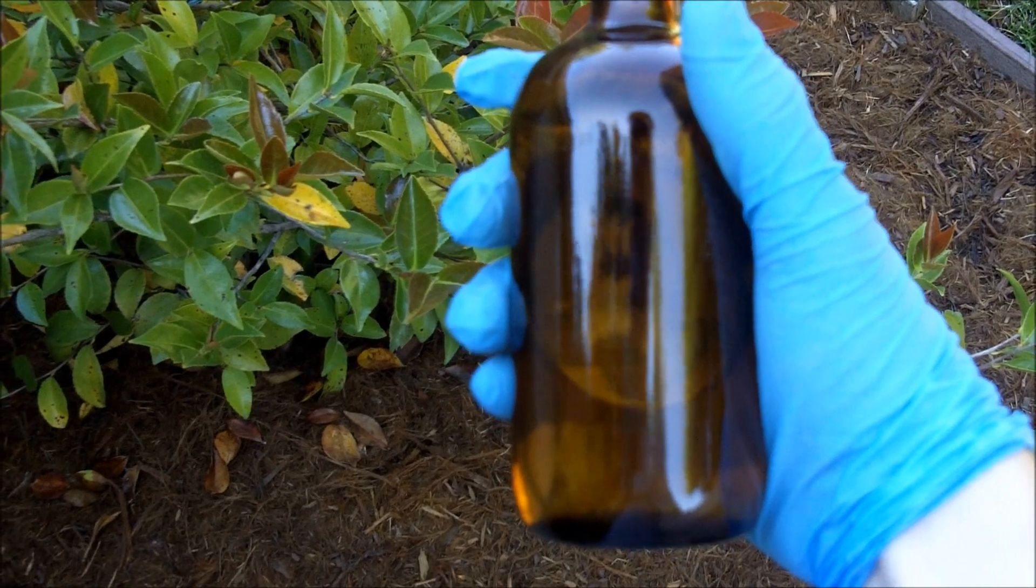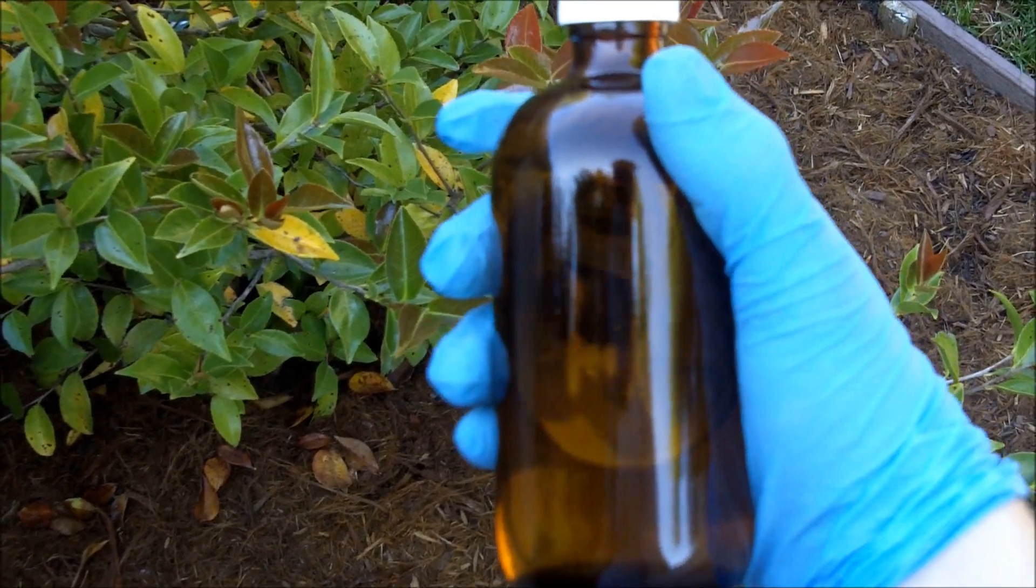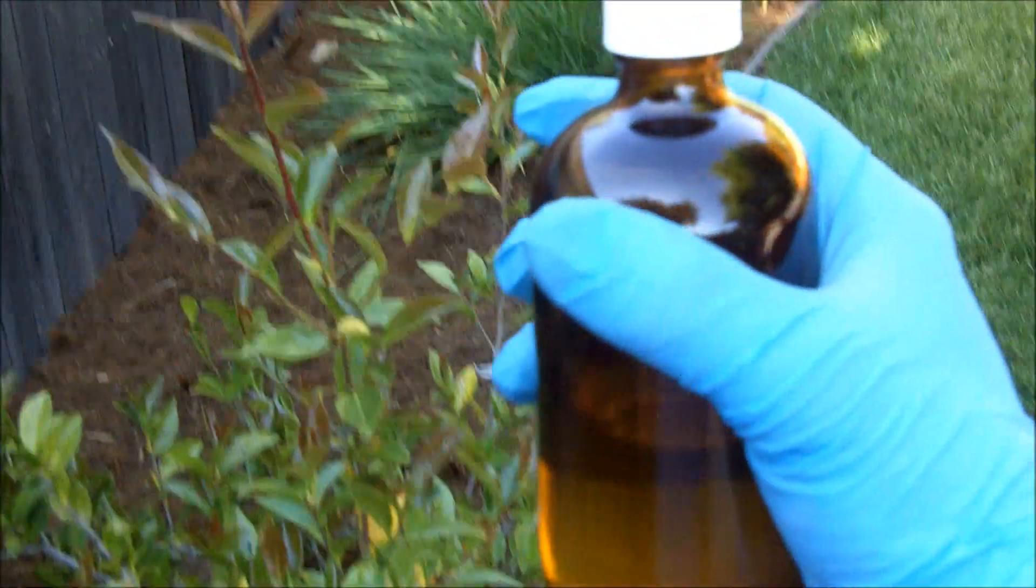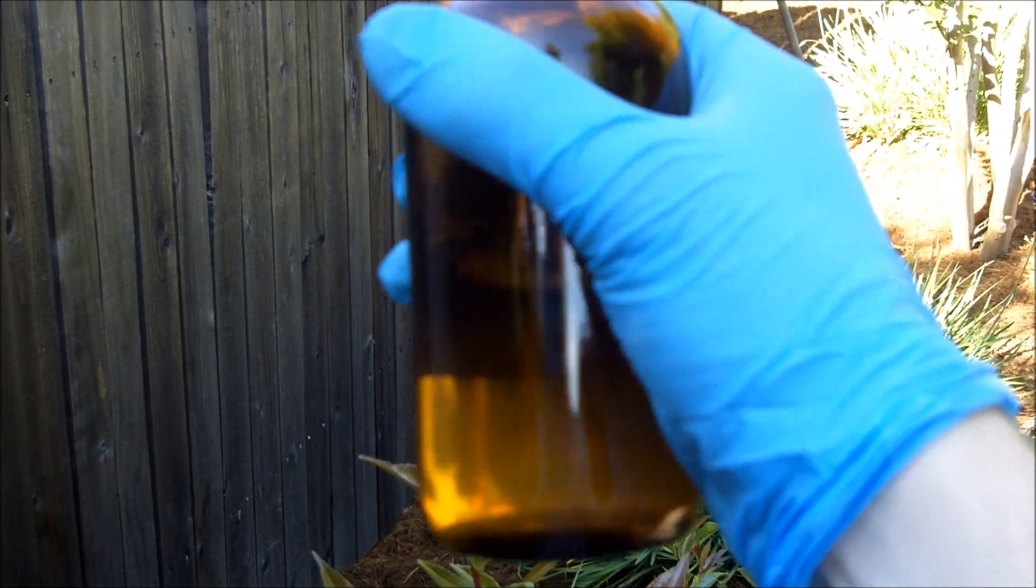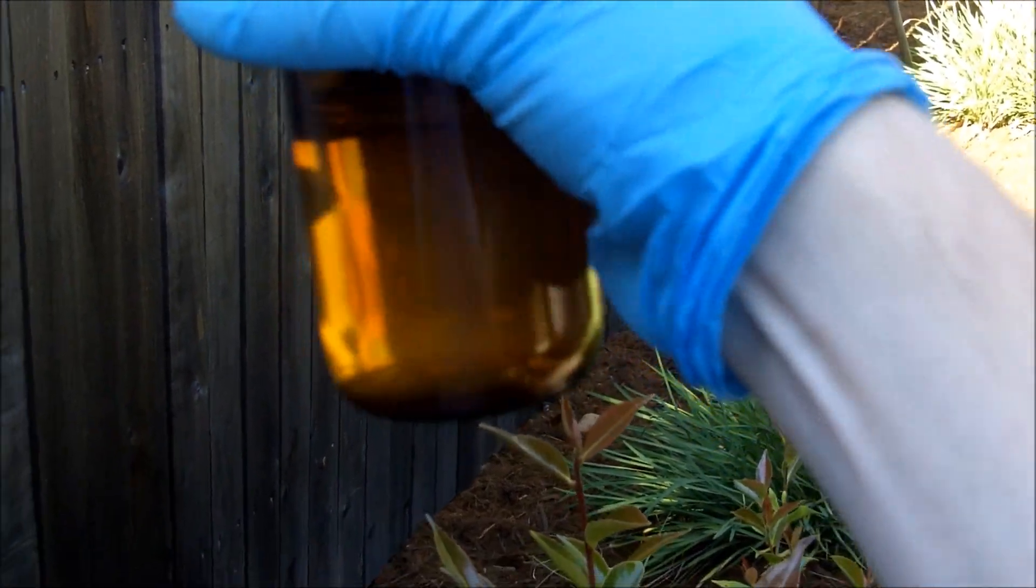Okay, I finished the distillation up until the temperature started to raise and dried my product, and then added a few milliliters of ethanol to stabilize it, and this is the chloroform I got.